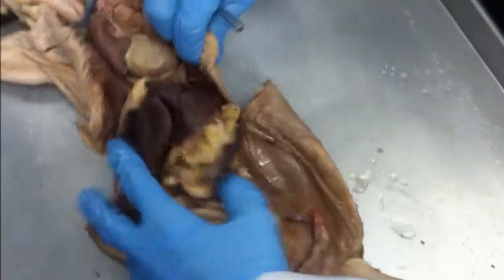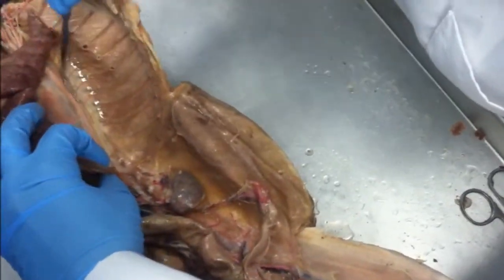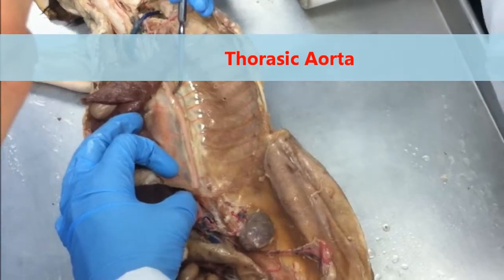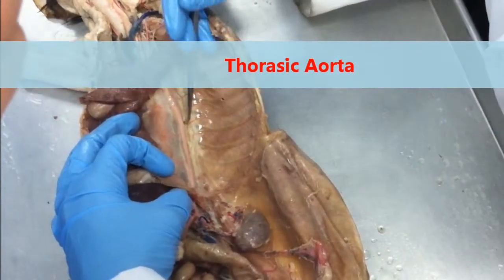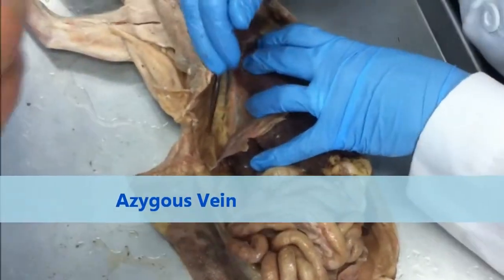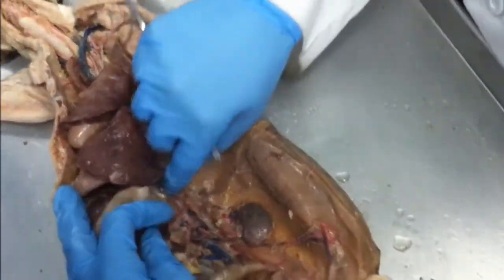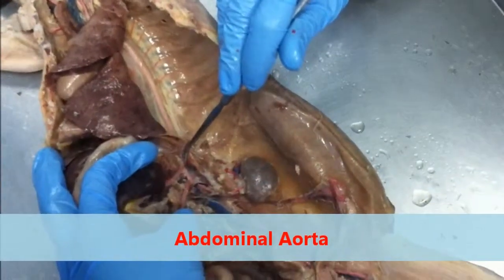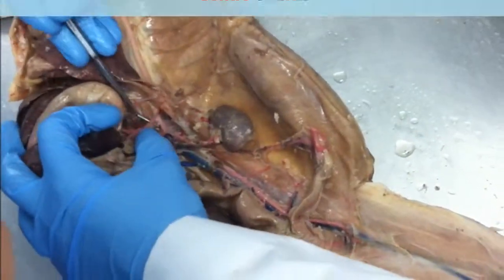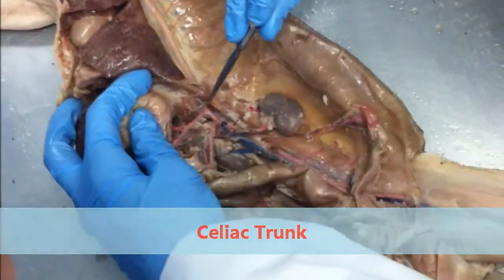Okay? Now, knowing those organs, we need to do our vessels that are associated with them. This is before the diaphragm, so what would I call this vessel? This red vessel here. Anybody? Thoracic aorta. Okay, on the other side, I see that my azygous vein follows the same path. Okay, azygous vein, thoracic aorta. Once I pass the diaphragm, it becomes my abdominal aorta. The abdominal aorta follows the spine. The first split off of my abdominal aorta past the diaphragm is my celiac trunk. The celiac trunk splits 3 ways.